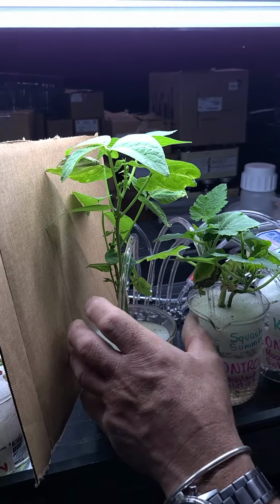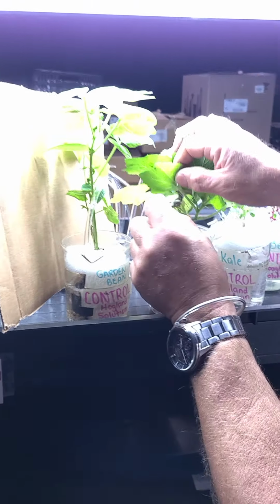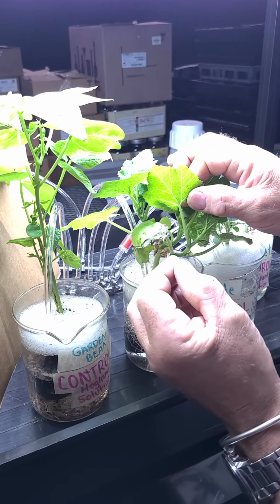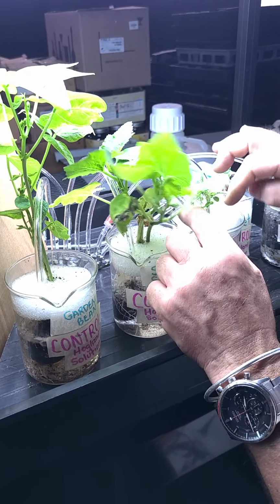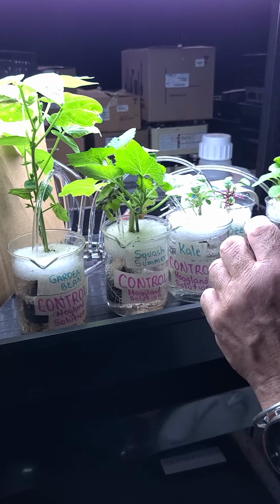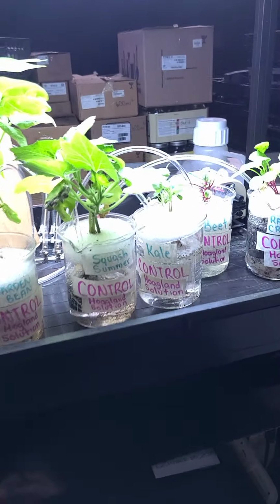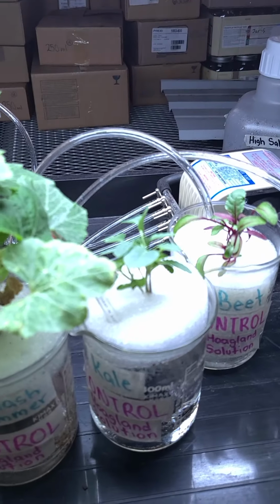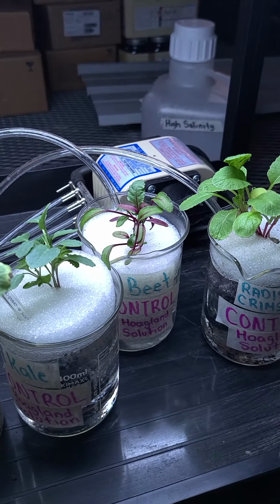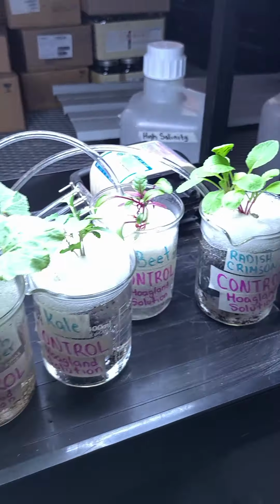If you look through there, we put that cardboard to make sure that you could see there was no issue. Here's an old leaf down here with a little bit of damage on it. There's a leaf at the bottom that's dried up. But generally, as I look at these, and if we zoom in a little bit or come down from the top, I personally don't see any issues. They seem to be pretty happy growing in this Hoagland solution.